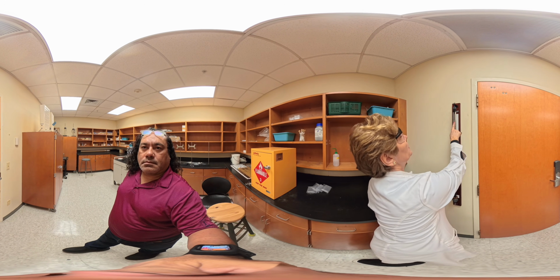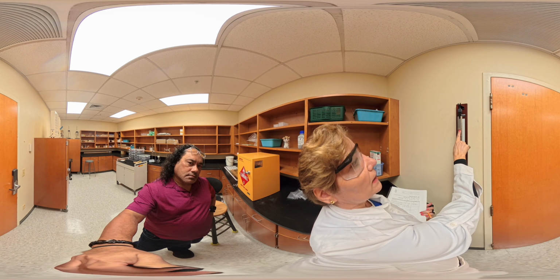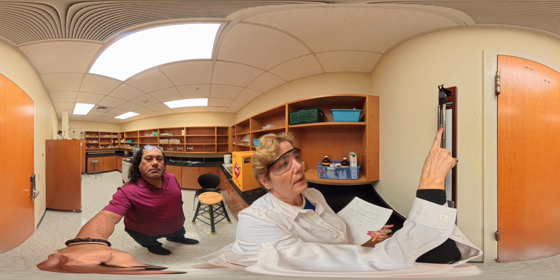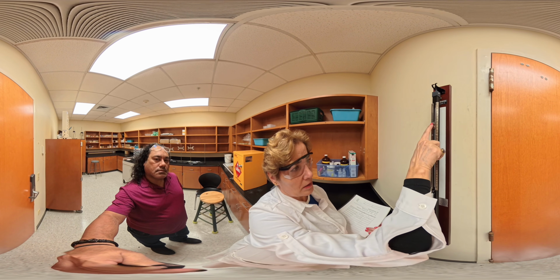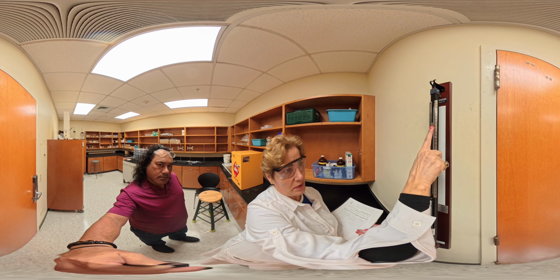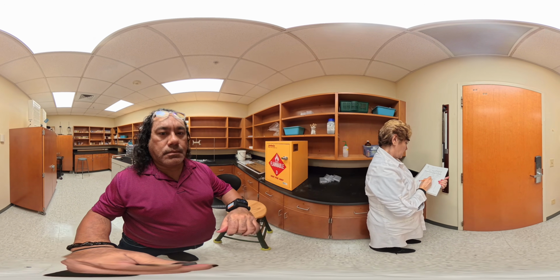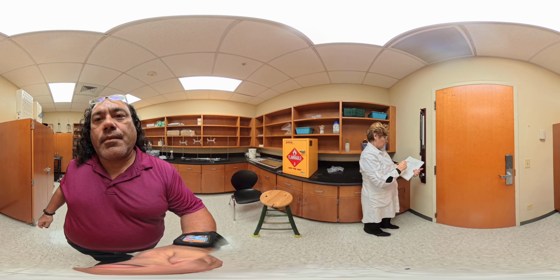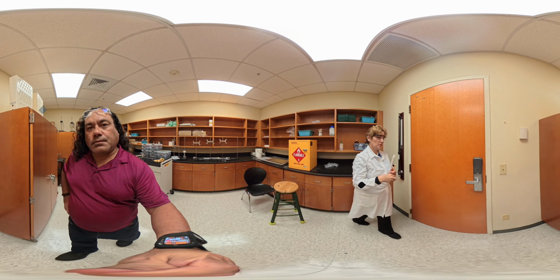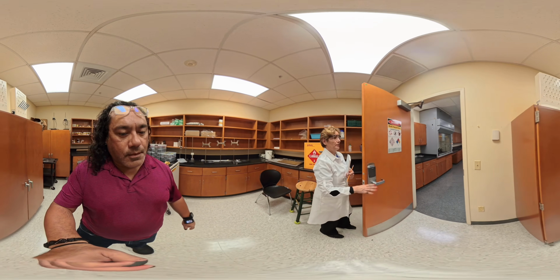It's 750, but we have to again read the meniscus. So with the meniscus here, it's almost 750, between 52 and 53. And then if you look at this number on the side, it's actually 10 lining up perfectly, so it would be 52. 752, that's the barometric pressure. That needs to be changed to ATM because that's what is used in the ideal gas law. And we can go back.